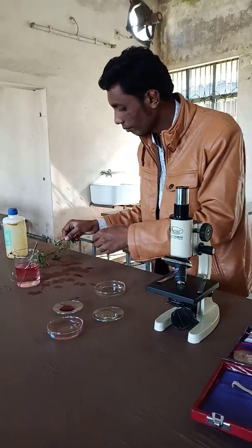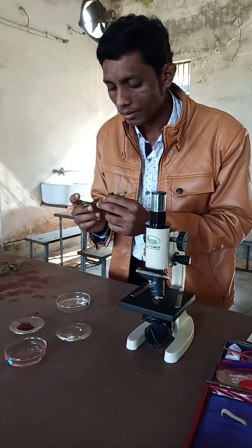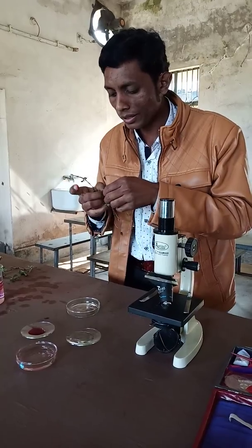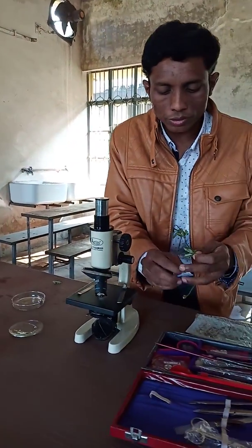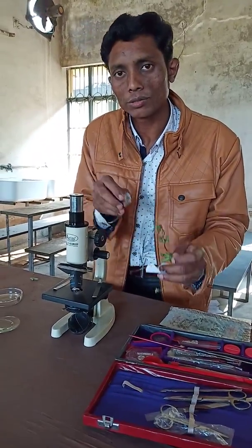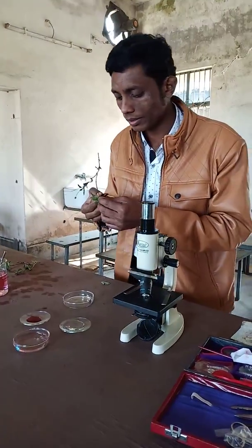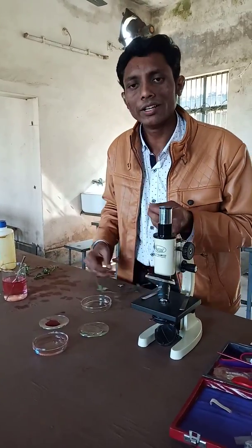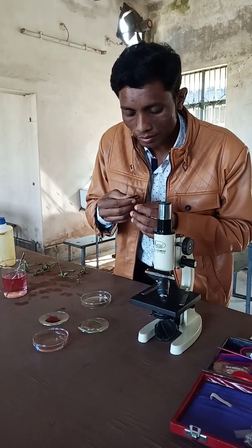First of all, we will take the stem of the Tridax that we need for the experiment. Here I am using a razor blade, and with this we will cut out thin sections of the stem.